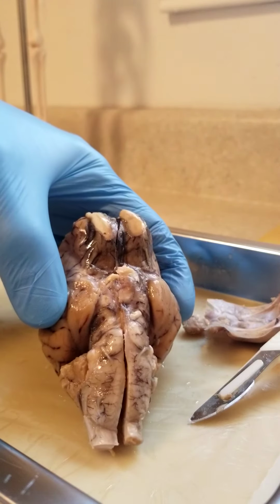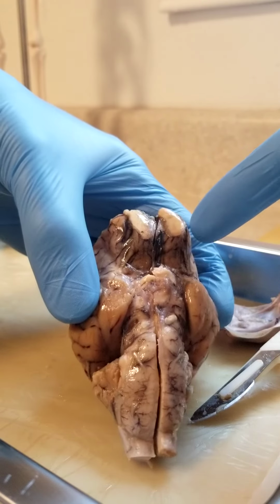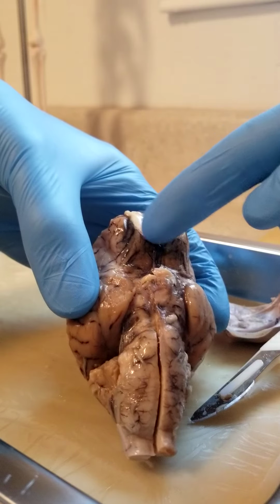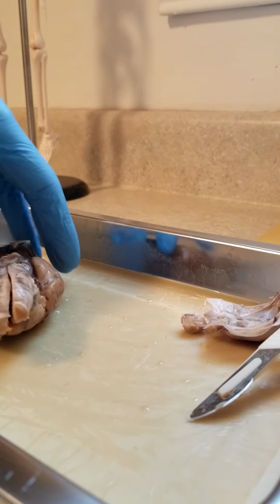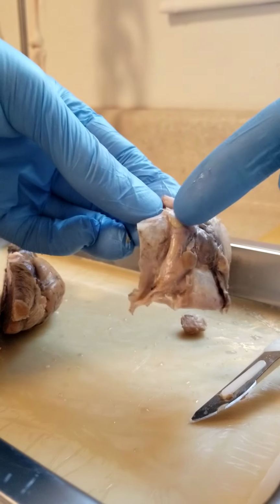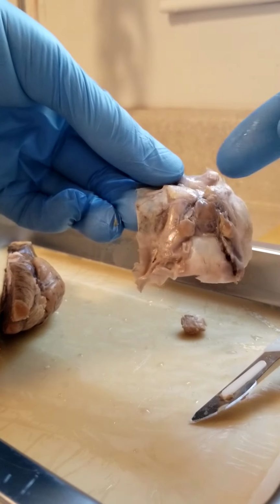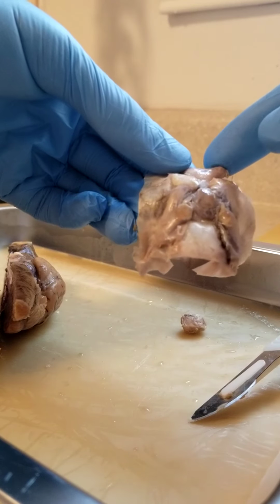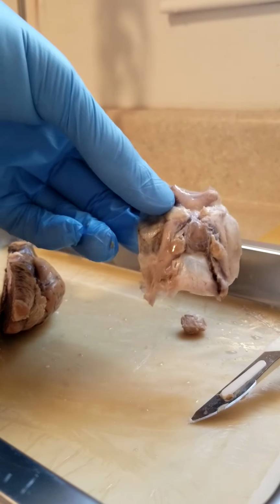All right, next we're going to the olfactory bulb, basically right there. And what connects those two is the olfactory nerve as well. Now if we're getting over to the optic nerve, that's right there, showing the optic nerve. The optic chiasm is basically the middle right there. And the optic tract is right there as well. Make sure to cover all those.